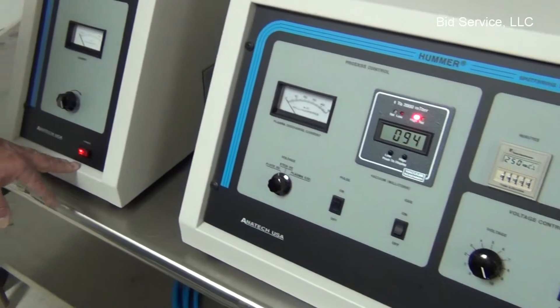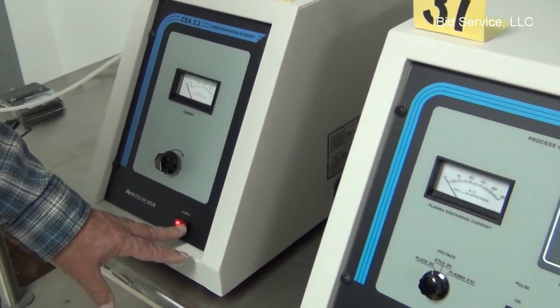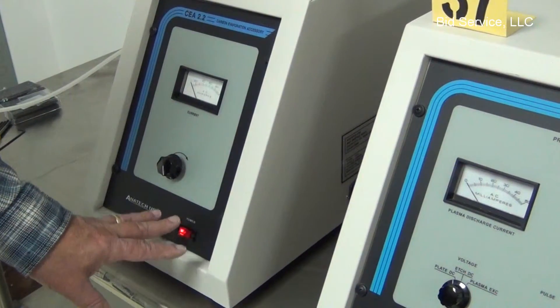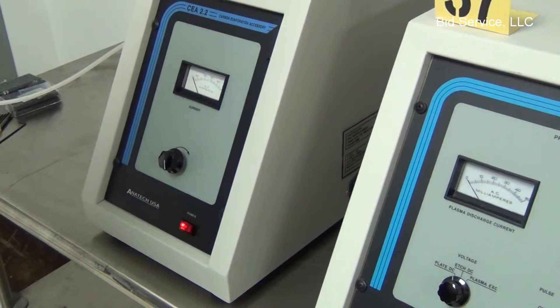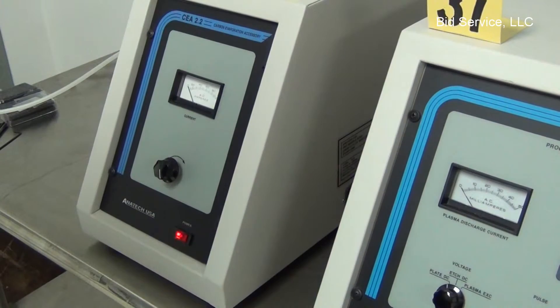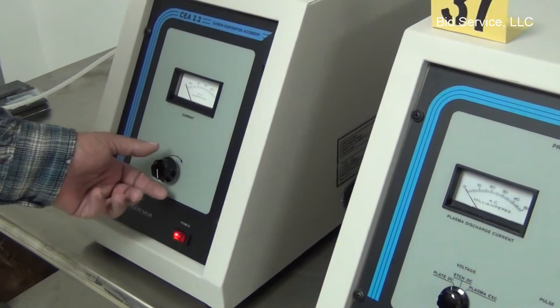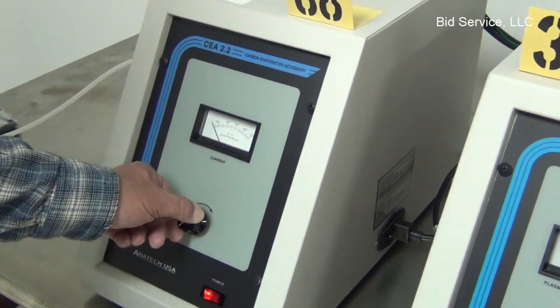The front of the CEA power will come on. This was off, even though the power switch was in the on position, due to the safety interlock. It will not allow power to go to this unless the settings are correct with the supplemental gas. So now that we're correct there, we don't have to do anything with the Hummer. Now we can increase the power to the CEA.